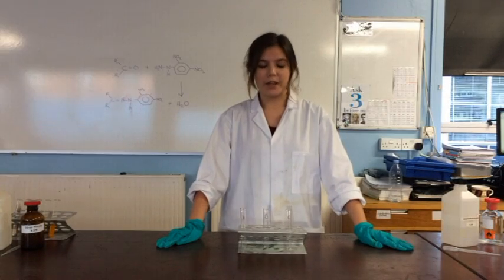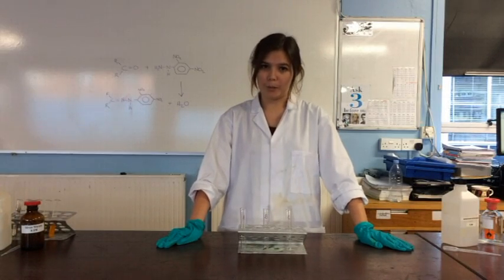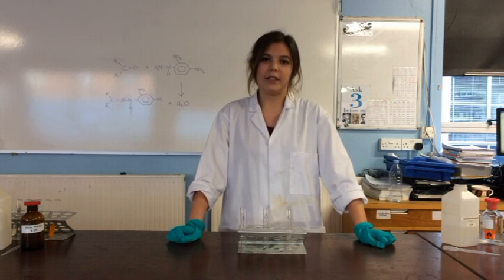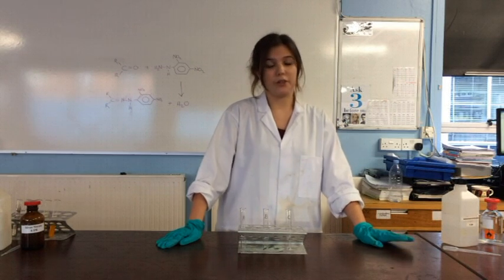Hi everyone, today I'm going to be doing some chemical tests on carbonyl compounds, specifically aldehydes and ketones. The first test I'm going to do is to test if you have either an aldehyde or a ketone.